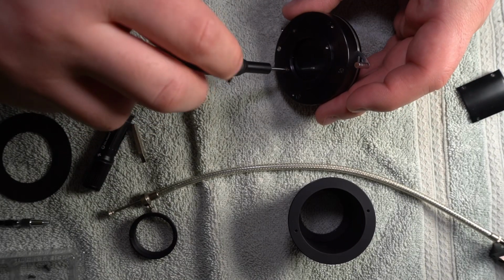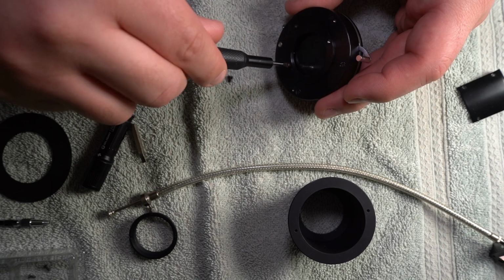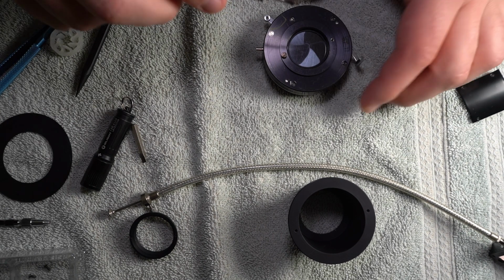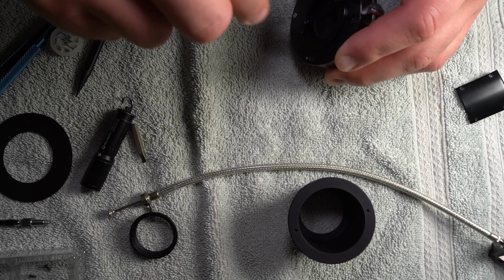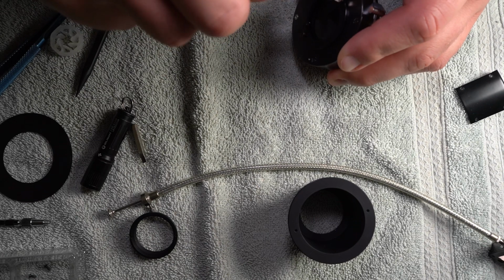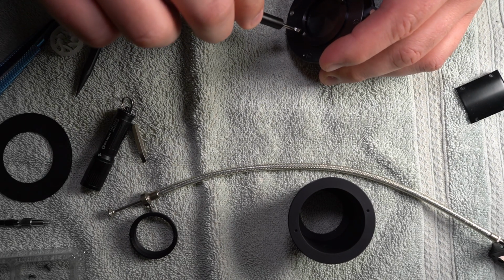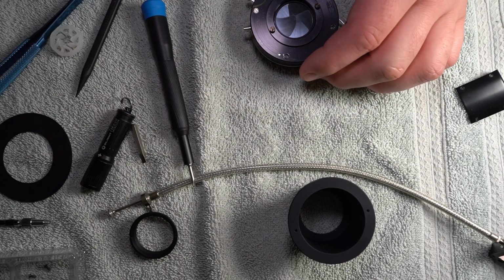So I'm putting this screw in. Now I think these two screws are literally just alignment screws. I don't think that they actually serve any real purpose. I could be totally wrong. They might be super important parts, but I don't know what they do. So I think that they're just alignment screws, which is kind of weird because the rest of this thing is alignment. It couldn't go anywhere either really.